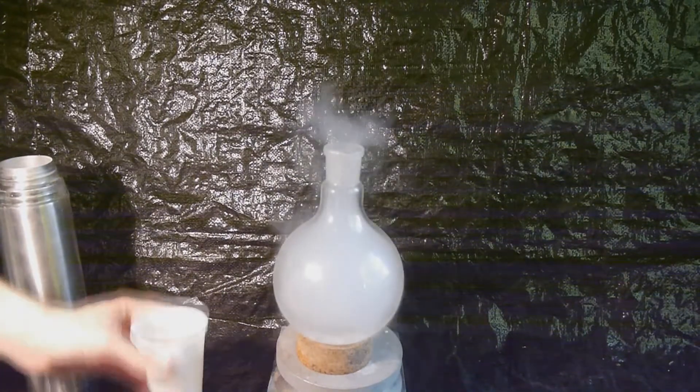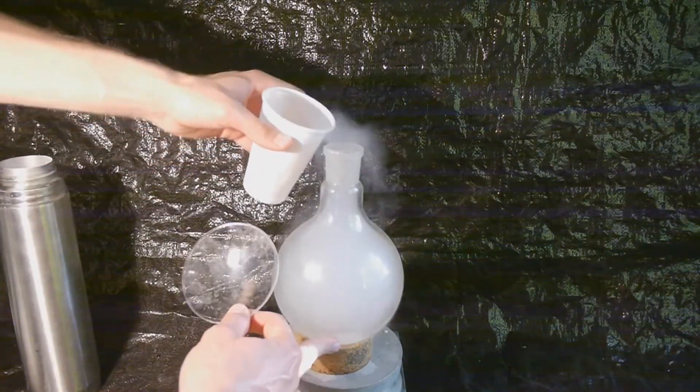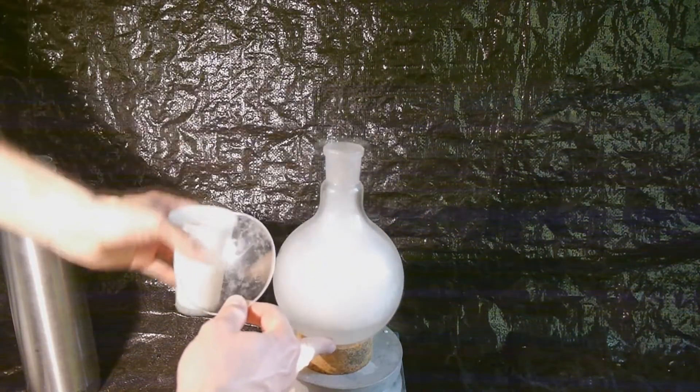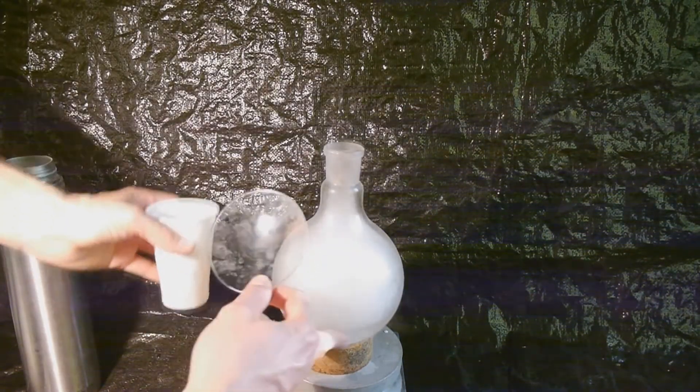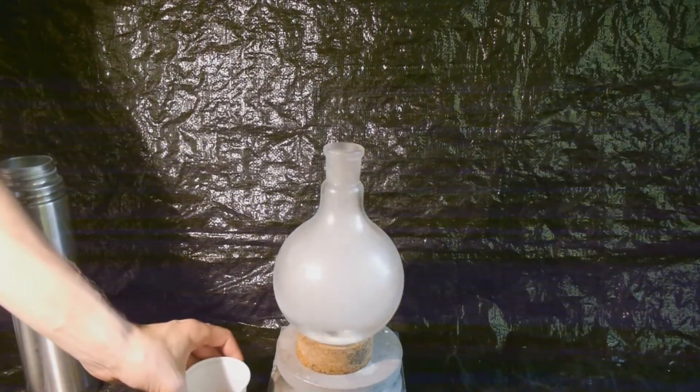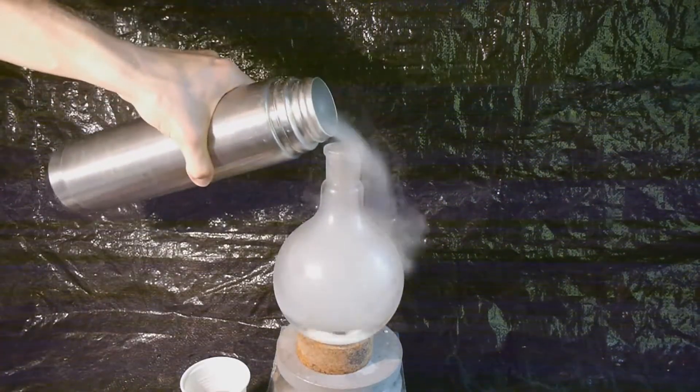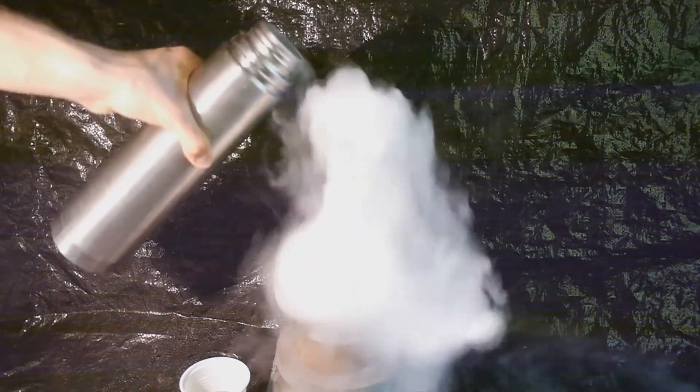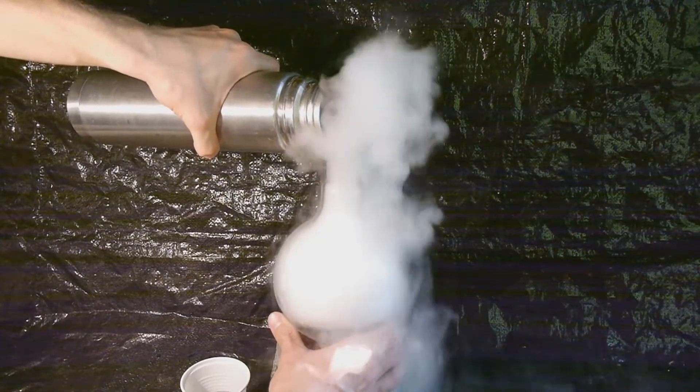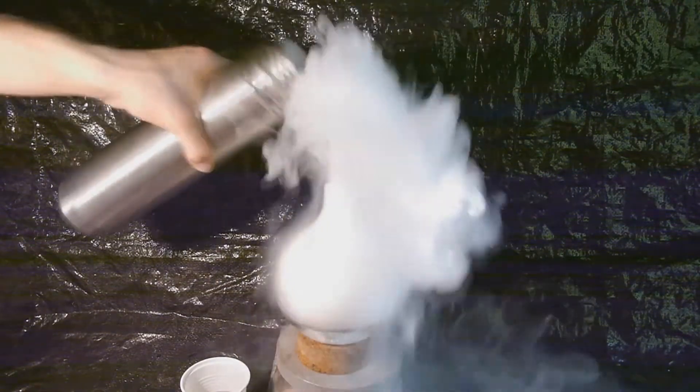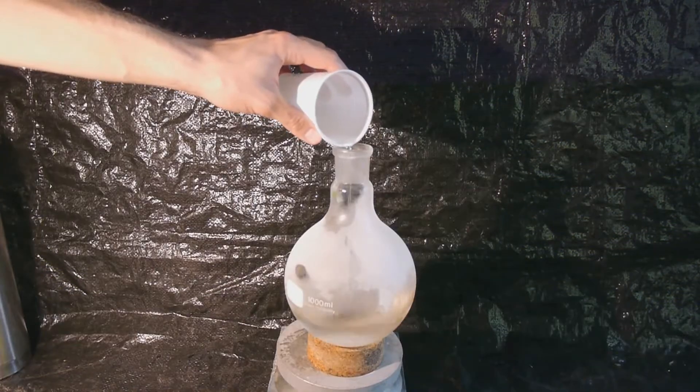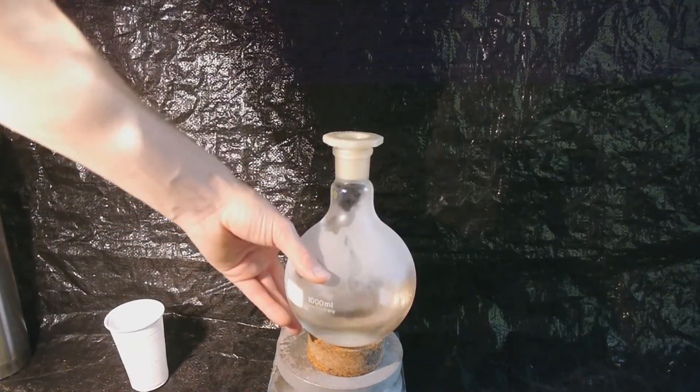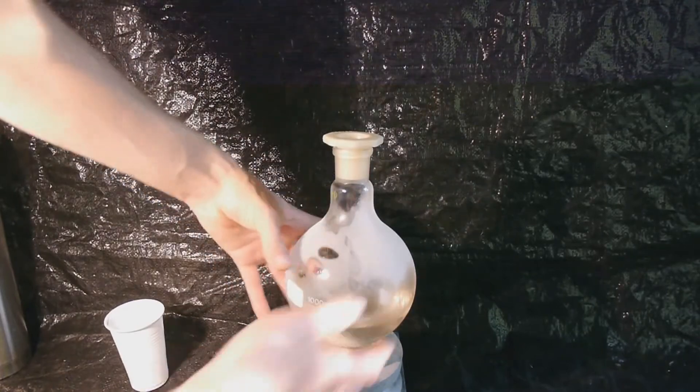So we can now start adding our sulfuric acid without having to worry too much about the formation of ether. This is now rapidly warming up again, so let's cool it down. It gets warm really quickly. All right, there we go. I guess I had just enough liquid air, which is amazing.